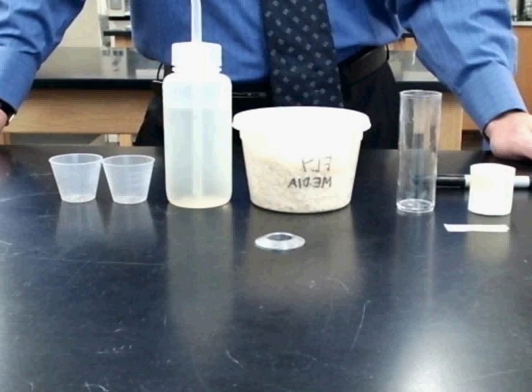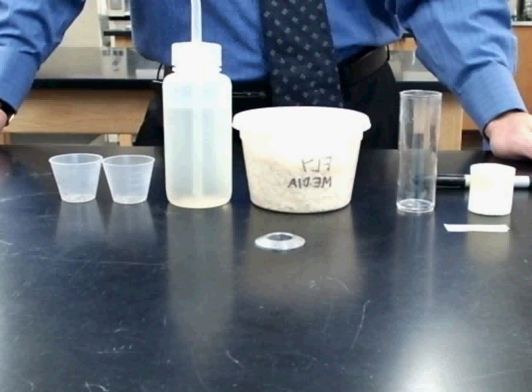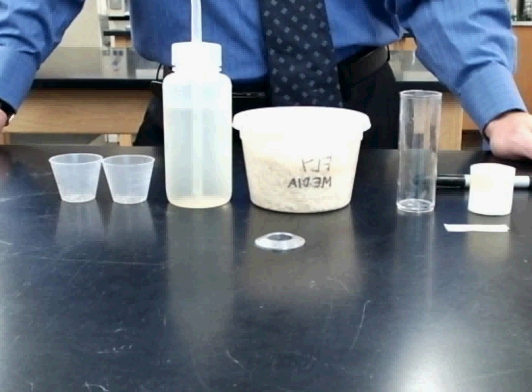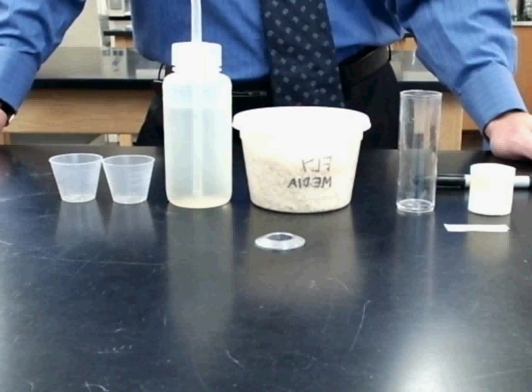In this video, I'm going to show you how to begin culturing Drosophila by preparing the culture media.